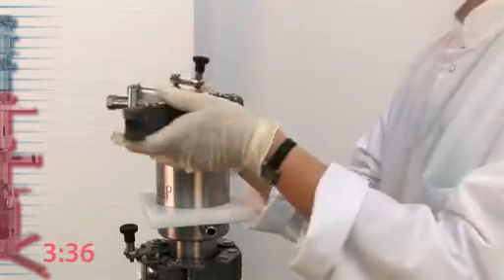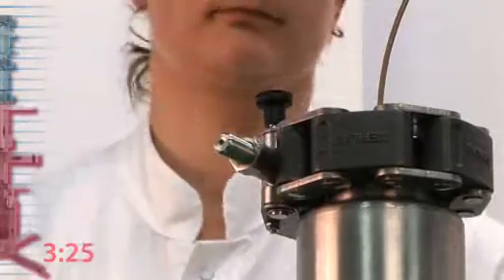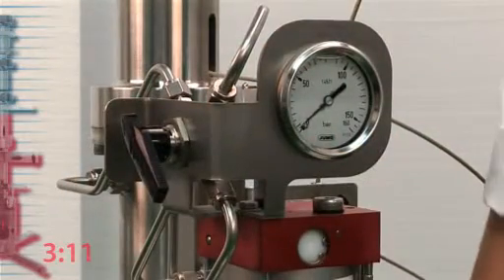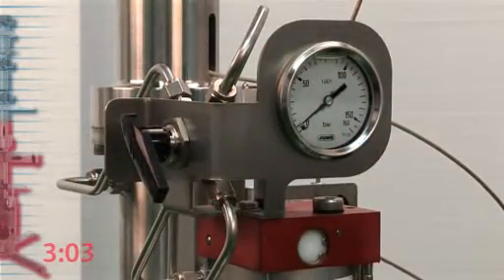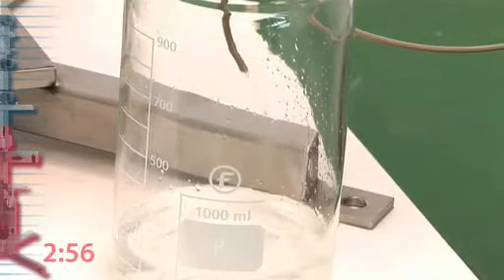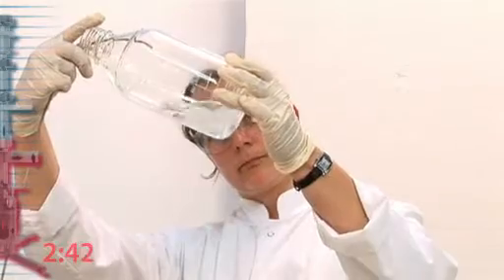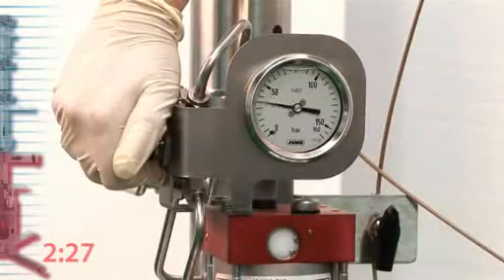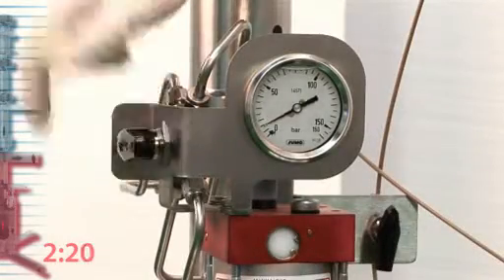Third step, we close the system and pressurize it. Fourth step, we decompress and disconnect the slurry vessel.